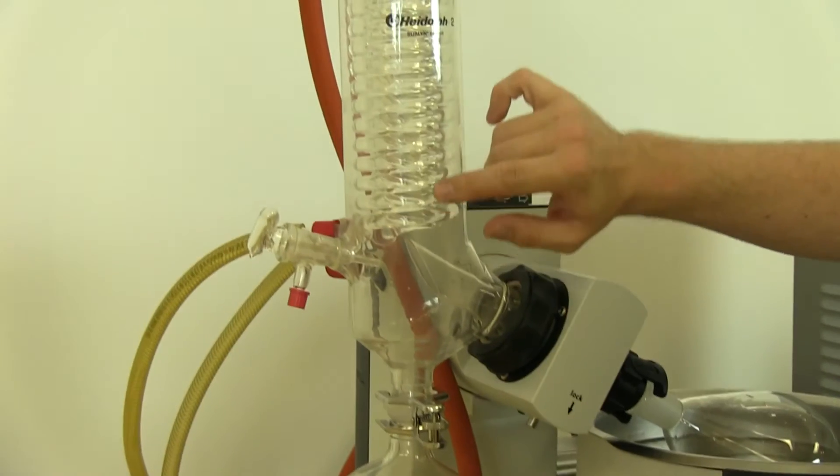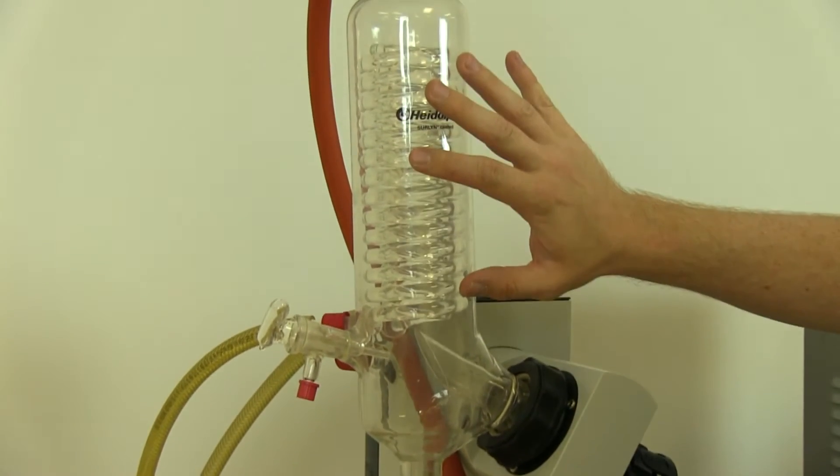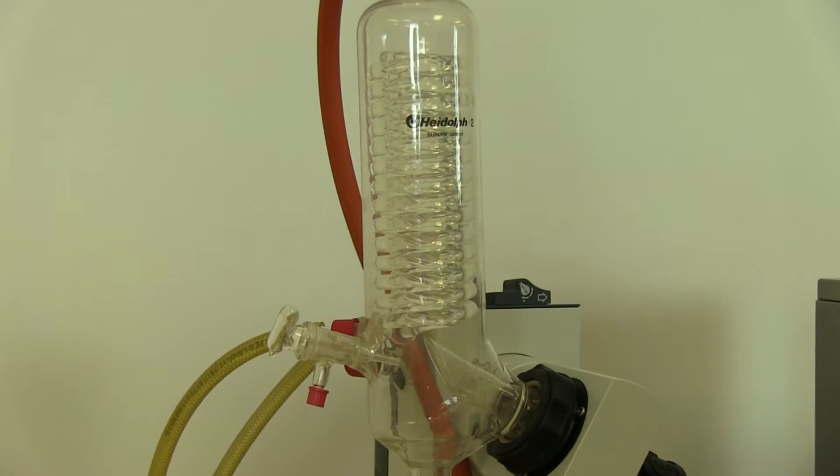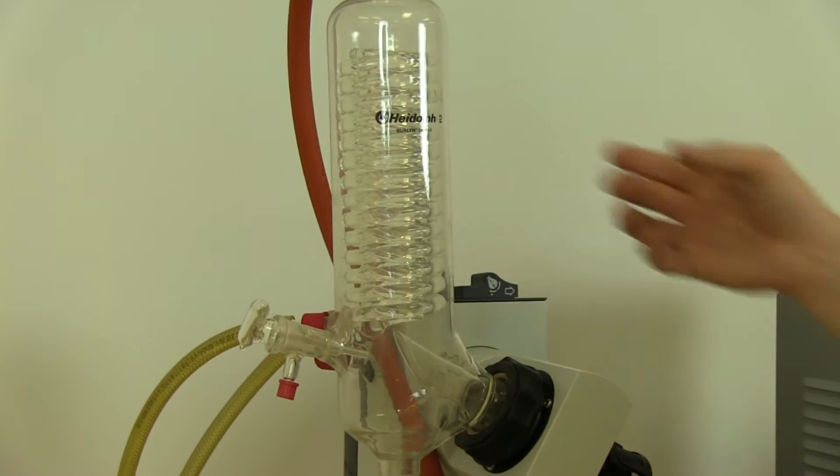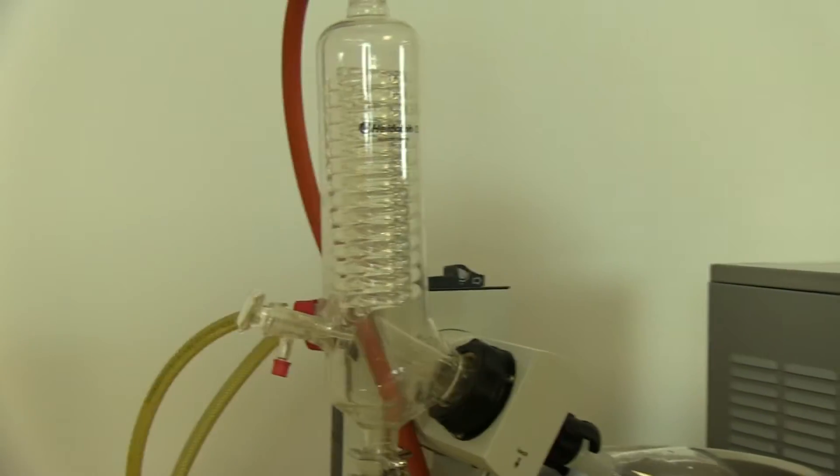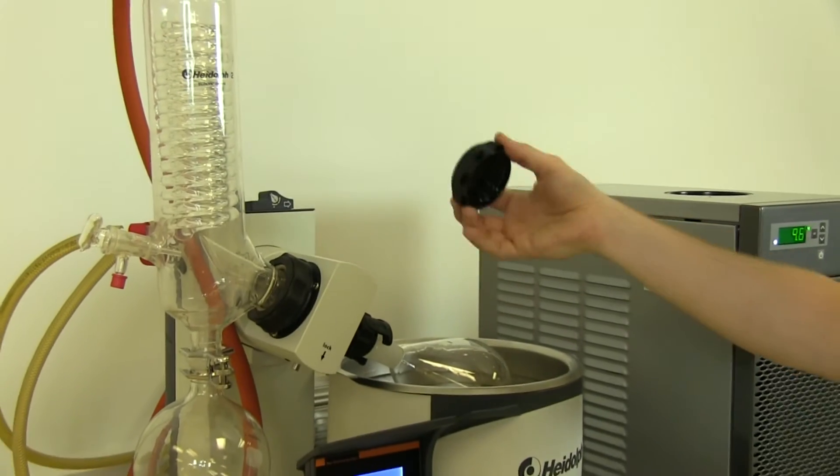You'll see air bubbles as the unit starts to settle and air is removed from the system. Once it is nice and clear, place your cap back on.